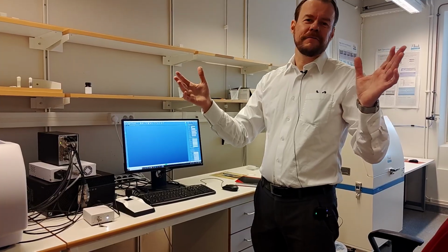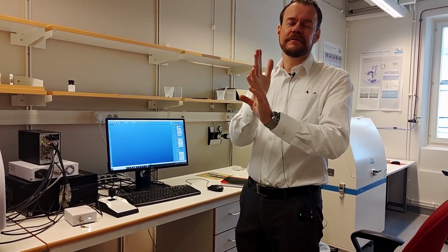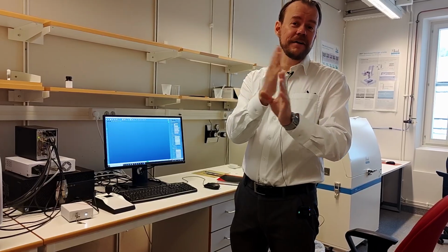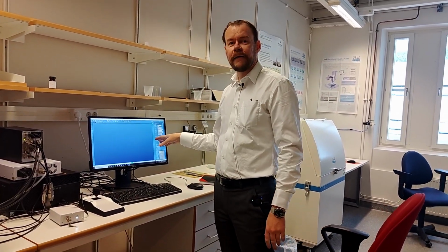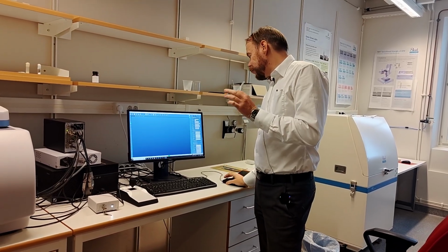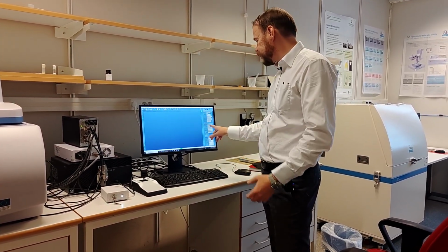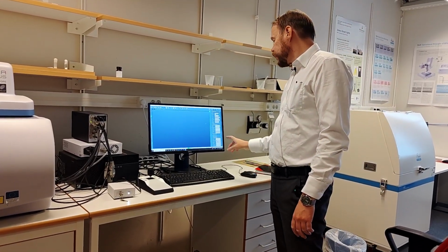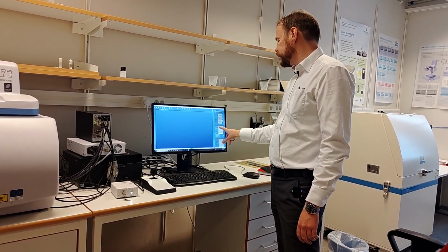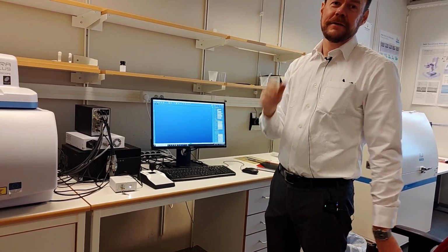So that means even if the center of the grating is on 800, 520 is still within 100 to 1500, so we don't have to do anything here. Otherwise, if we really want to change, we can put this on 520. If I write 520, then the spectrometer grating will start to turn. This takes some time, and then it will position itself at 520. So now the silicon peak will be exactly in the middle.